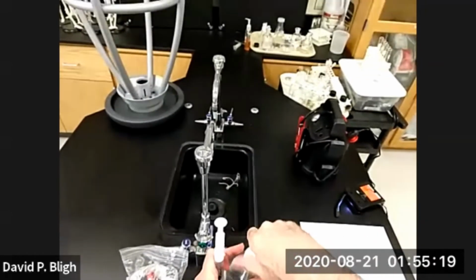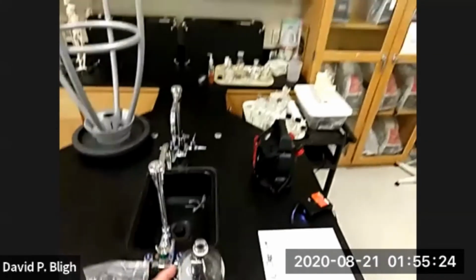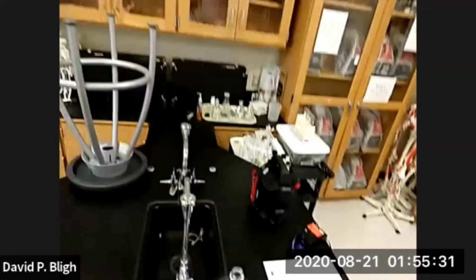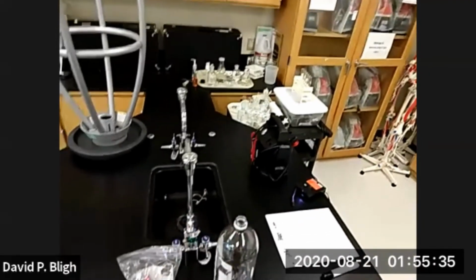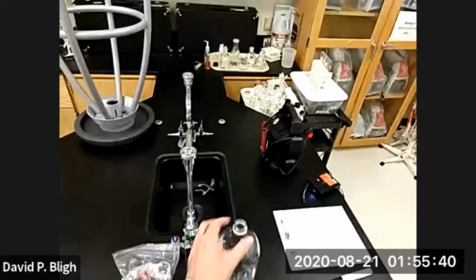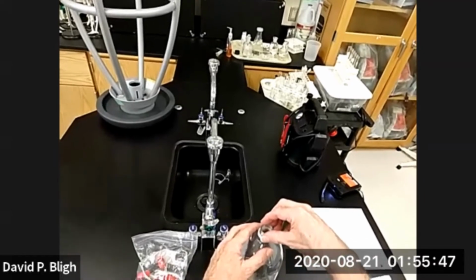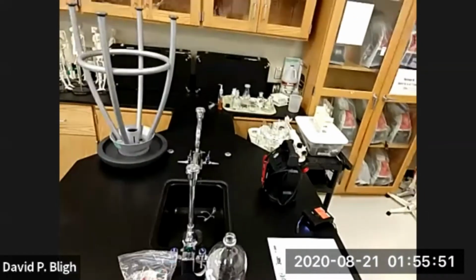So we insert that into the pop bottle, and these pop bottles are one experiment only. Once we get finished with this experiment, that pop bottle goes in the trash, because it's been under a lot of stress and the risk in future experiments of explosion is too high. So they're cheap, disposable. We use them for one experiment and that's it. So we put the syringe in here. There we go. And then we seal it in such a way that we can add pressure.